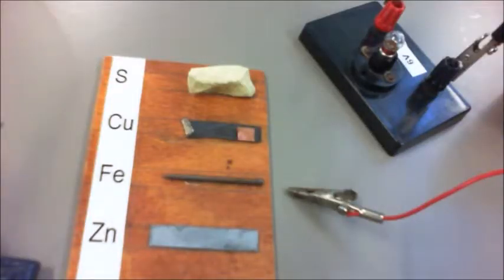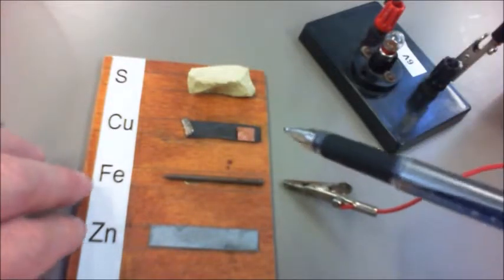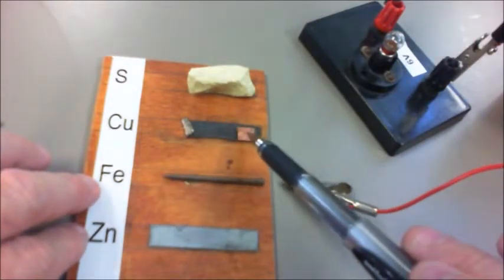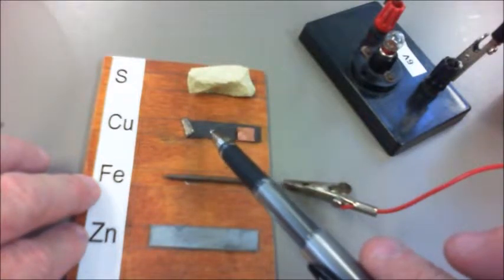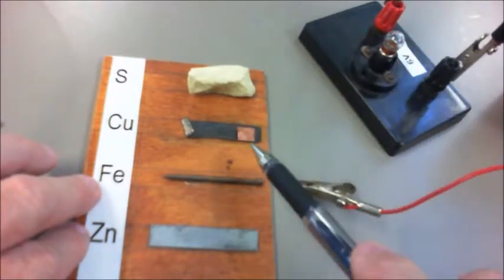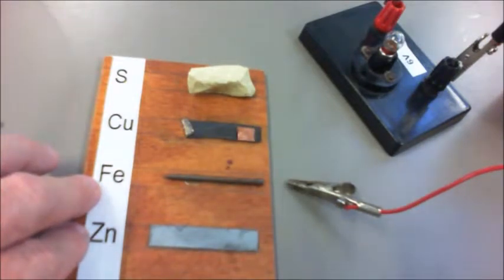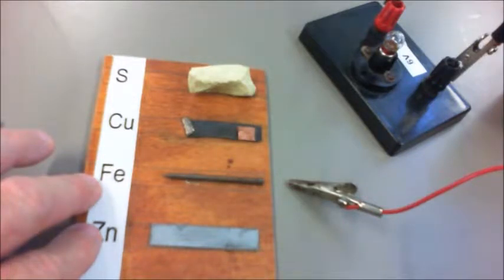Okay, now that you've copied down the experimental write-up, let's look at the physical appearance of each of our three metals. We have copper. In copper you can see there's a very light section where my pen is and a very dark section there. The dark section is due to the oxidation of copper in the air. So there is an oxide coating that goes onto the outside of the copper that makes it look dull. The shiny piece is what unoxidized copper actually looks like. So you can write down the physical appearance of the copper there.